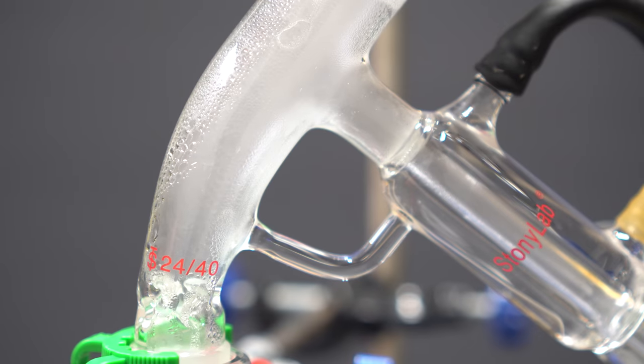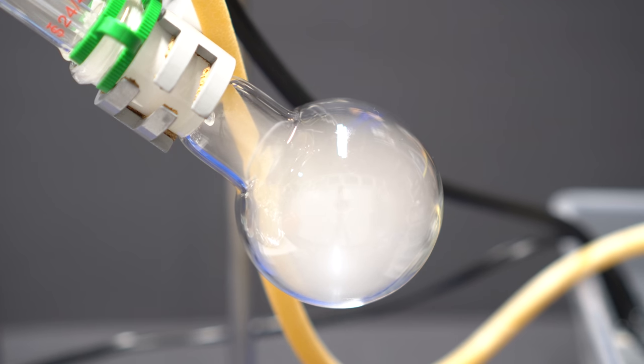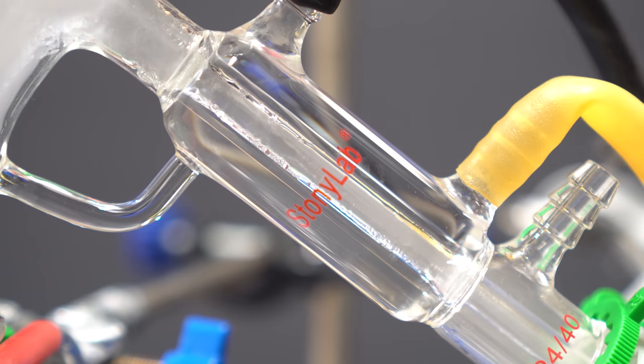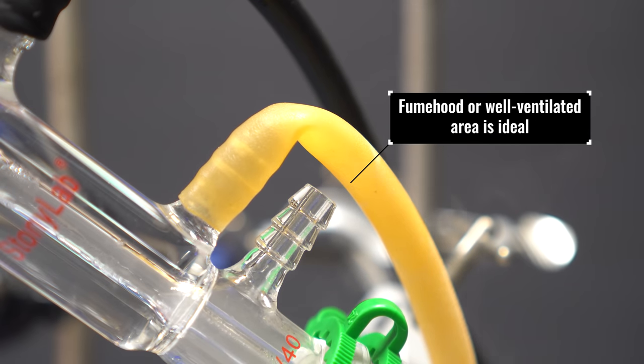As the reaction progressed, more and more smoke and a lot of pyridine started to condense in the condenser. The receiving flask also had a bunch of vapor inside of it. A fume hood or well-ventilated area is highly recommended as this smells terrible. A good suggestion is to do this in your neighbor's yard. For legal purposes, that was a joke.